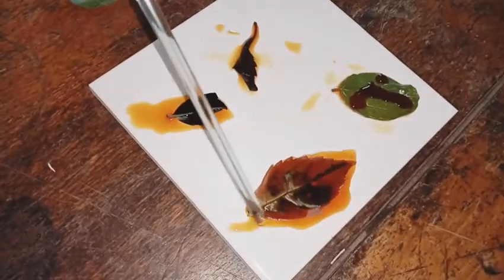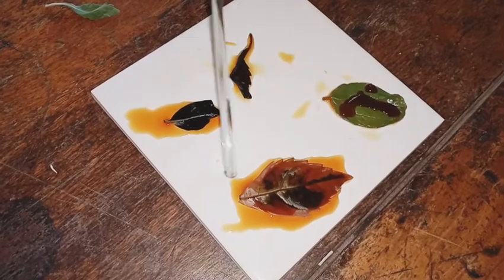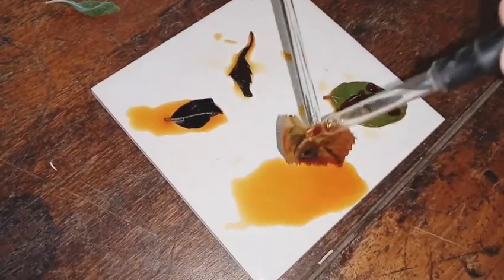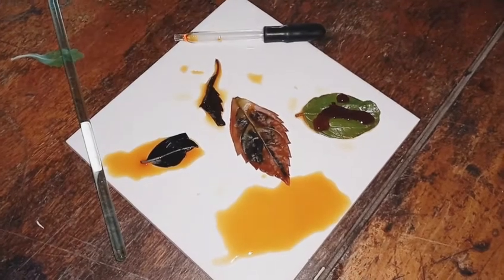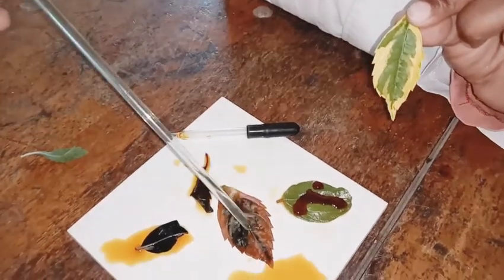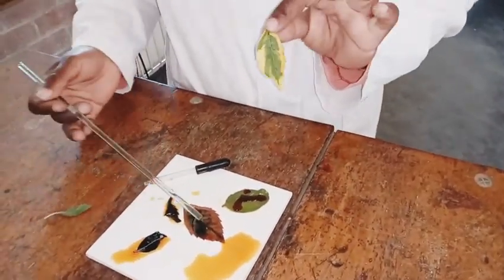Then with this variegated leaf - this one is quite interesting. The color is developing nicely. Can you see where the blue-black color is? In the regions which were marked green. But the yellow edges? Nothing. It's just turned yellow-brown, which is basically the color of our iodine. It did not turn blue-black.